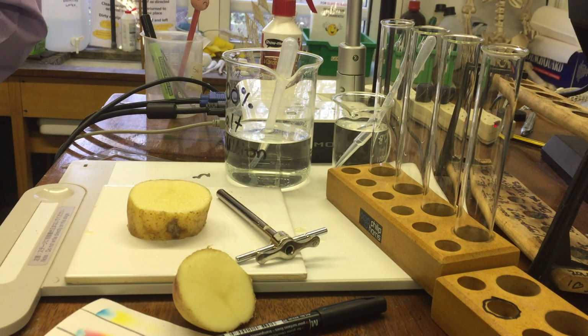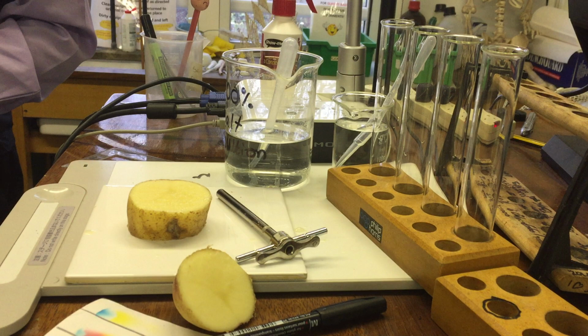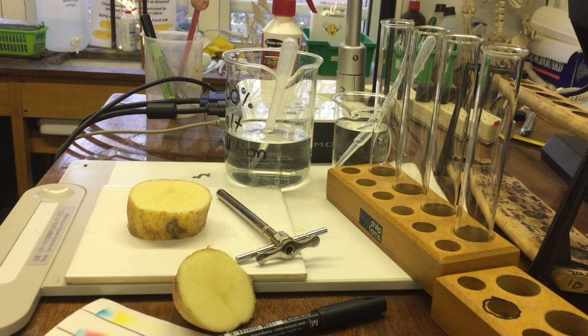What's the variable that we are going to be measuring? The change in mass. And so to measure a change in mass, we need to know what 2 things? The initial mass and the final mass. Good. So we're going to measure the change in mass. And actually, in fact, we're going to change that also to percentage change in mass, and I'll explain why in a minute. There are quite a few controlled variables.